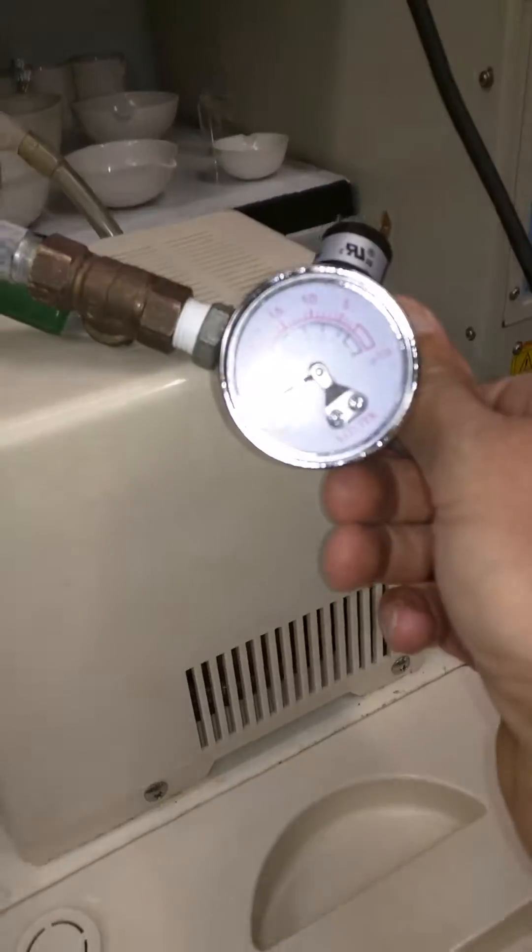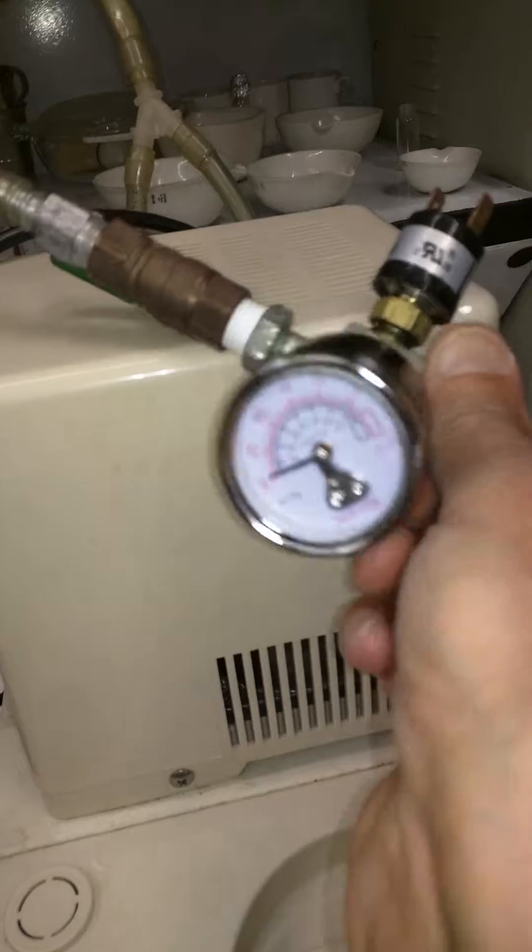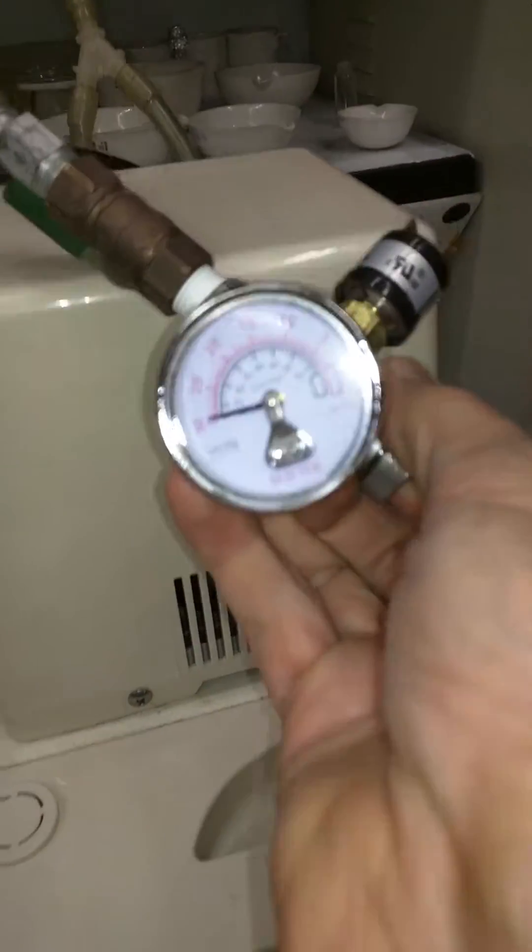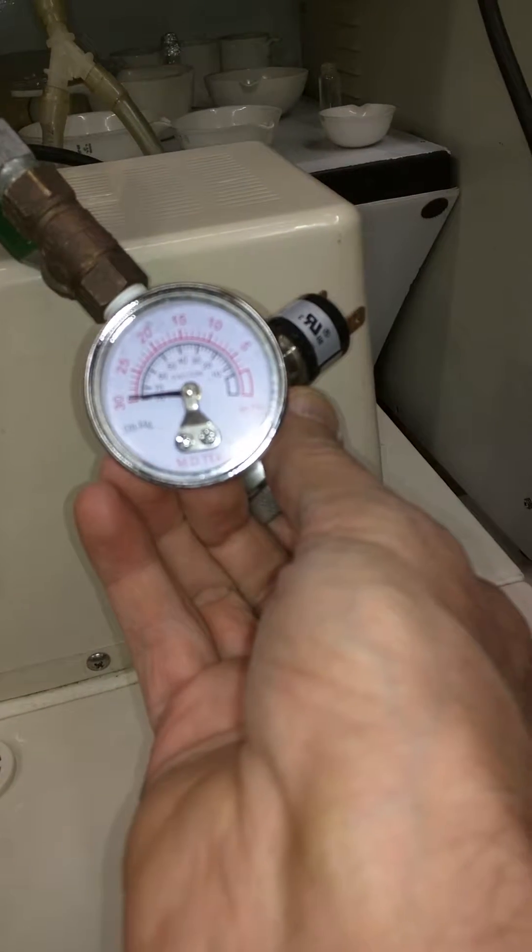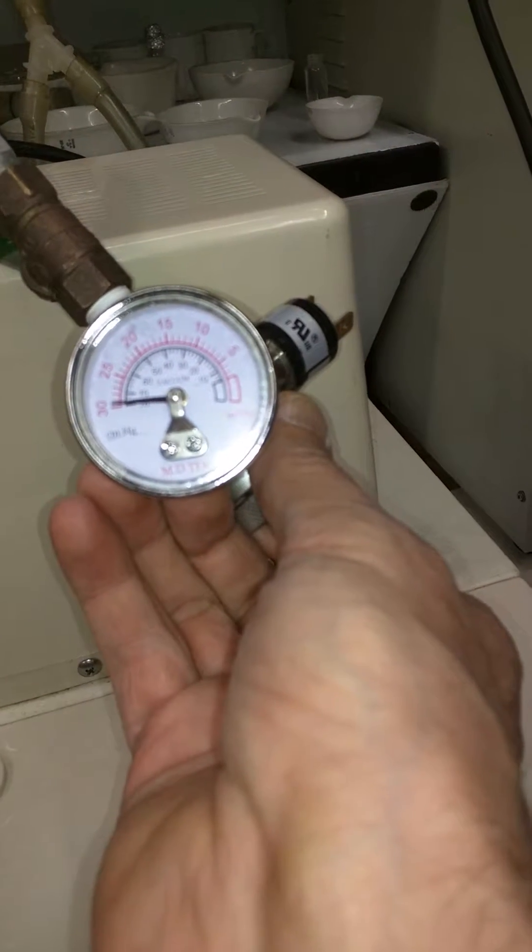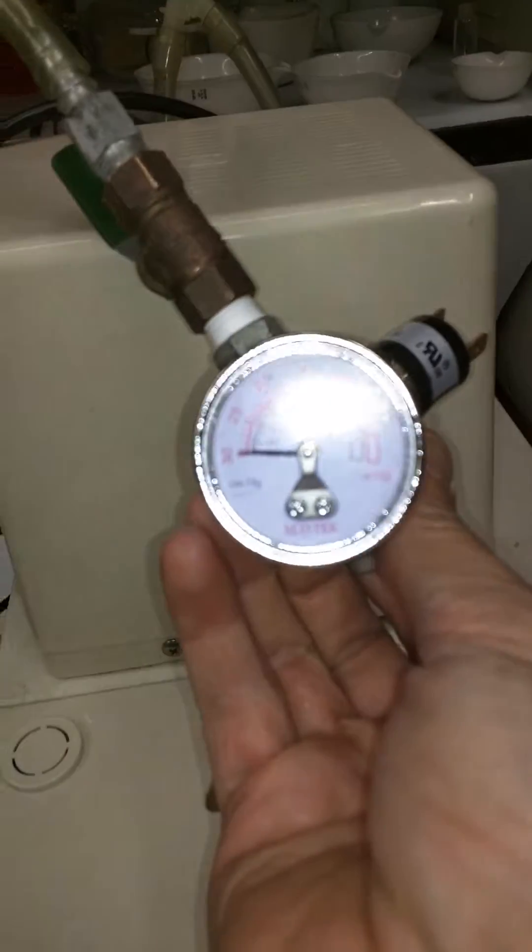Okay, so we can see it is going near 30. Basically, I think that's where it sits. So it is near perfect vacuum.